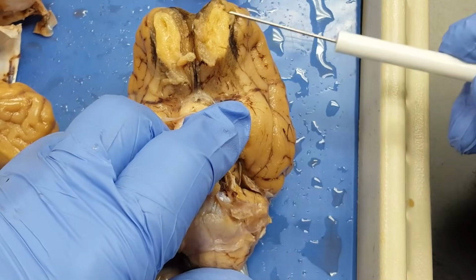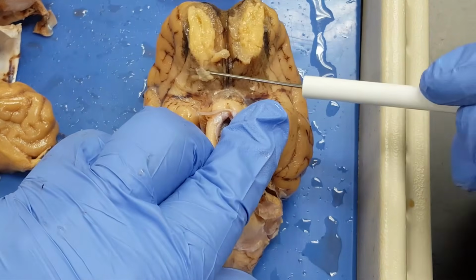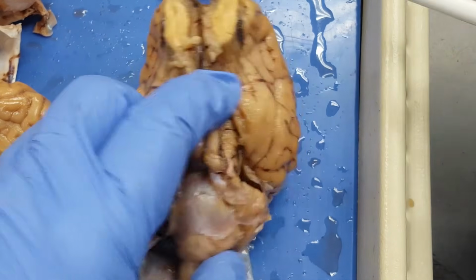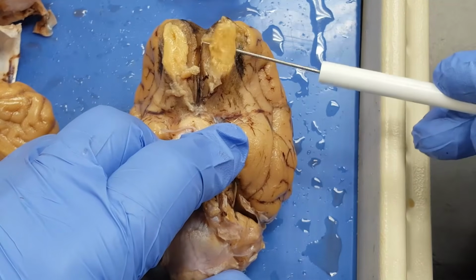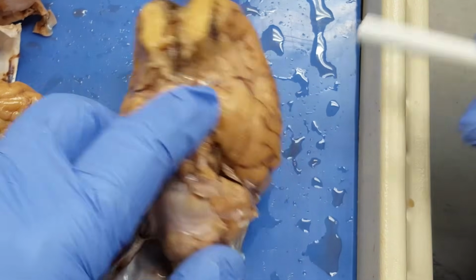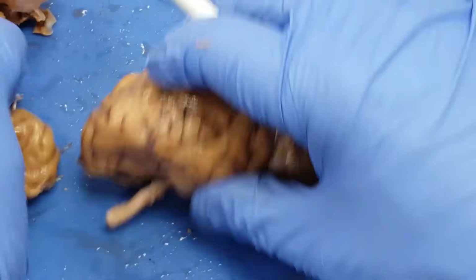Now I can see these two sort of white structures right here. These are the olfactory bulbs. And then the nerve that runs back from them, I can see this one right here, is the olfactory tract. Notice how much larger these are as a portion of the brain than yours or mine. This sheep has a much better sense of smell than we would have. But the cerebrum isn't that big as a part of its brain, so it's probably not doing any calculus.